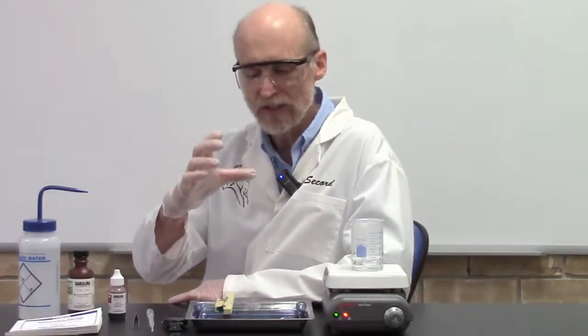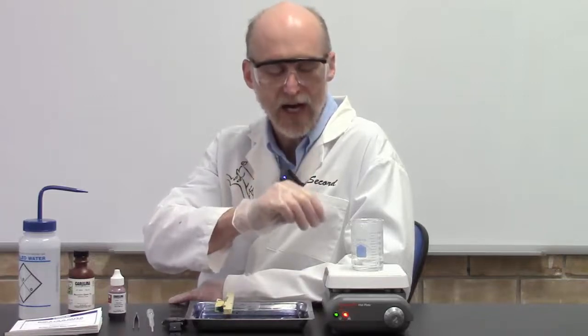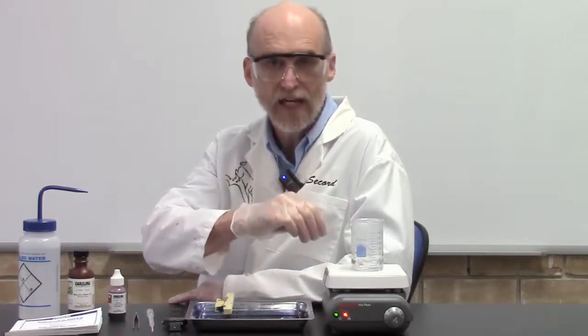One other very important item is eye protection, because we're using stain over a hot plate. If it drips on the hot plate, that hot steam and stain can splash into your eyes. So make sure you protect yourself. All right, so let's start with the technique.